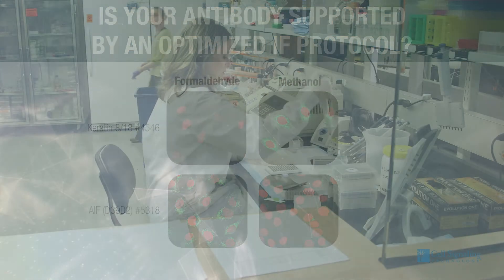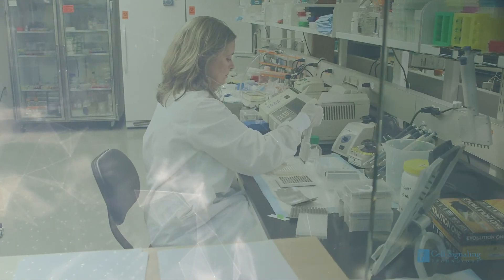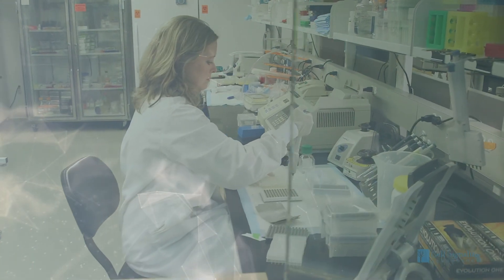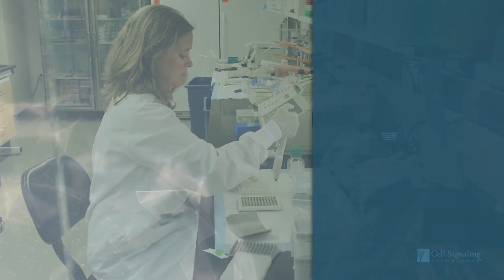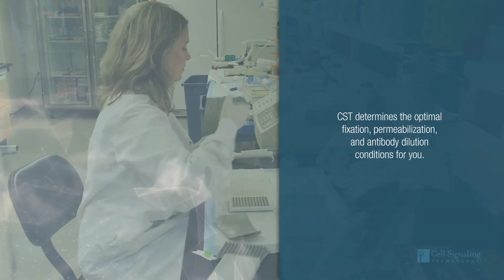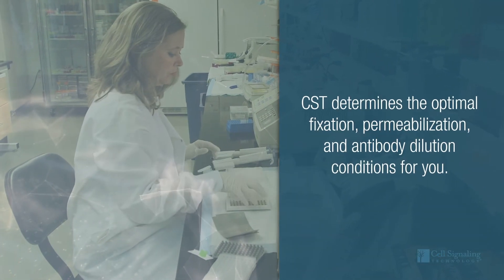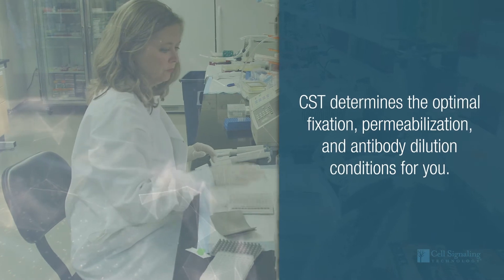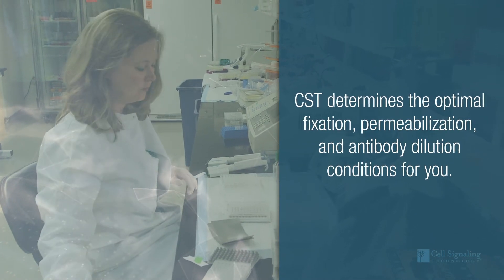Save yourself from spending precious time and reagents on efforts to optimize a protocol that already works. At Cell Signaling Technology, we have determined the optimal fixation, permeabilization, and antibody dilution conditions for you.